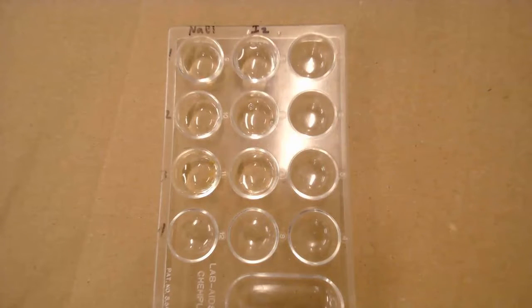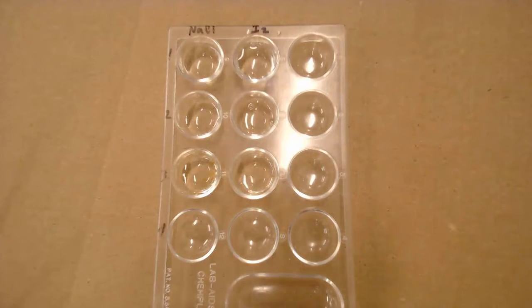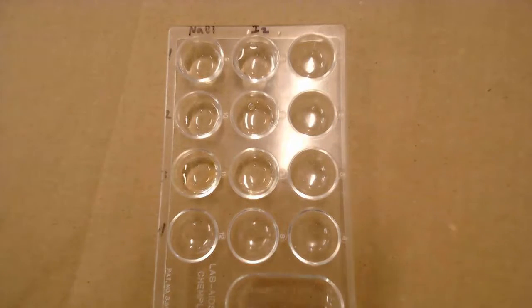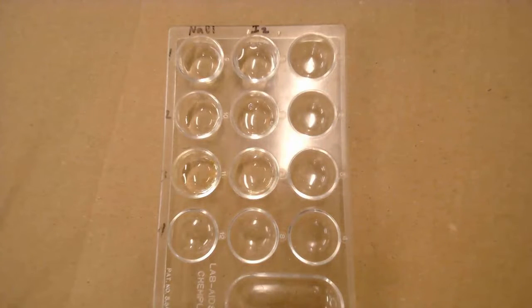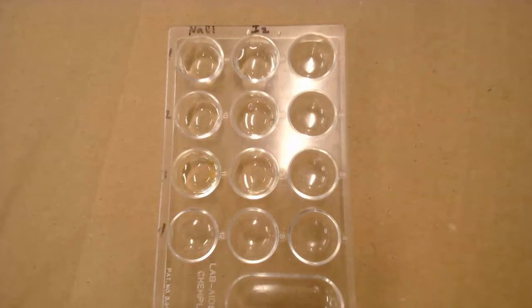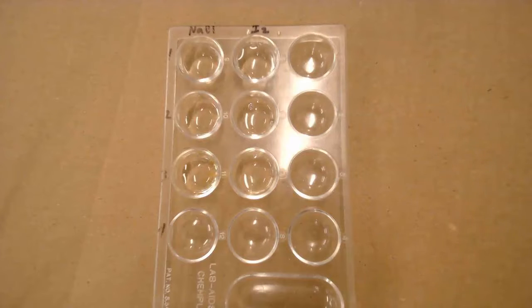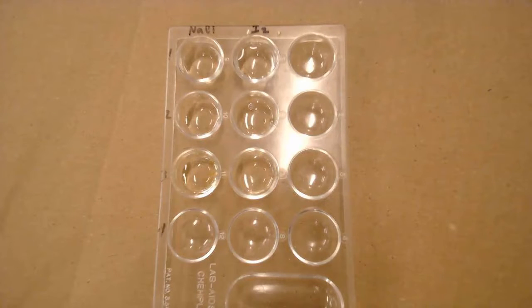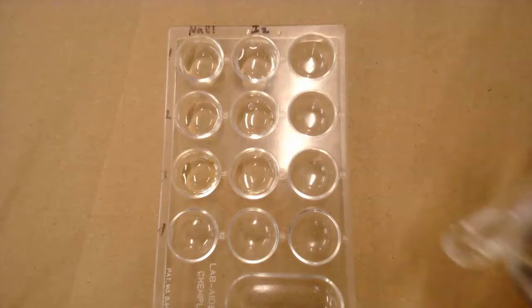And the last well I'm going to fill with the unknown substance, glycerin. We don't know if it's polar or nonpolar yet. Now, glycerin is a very thick liquid — it's somewhat hard to pull out. So I'm going to try to get a little bit out of here. And we have glycerin.